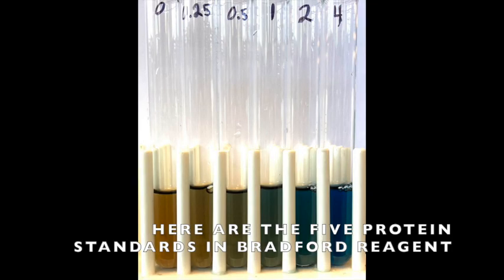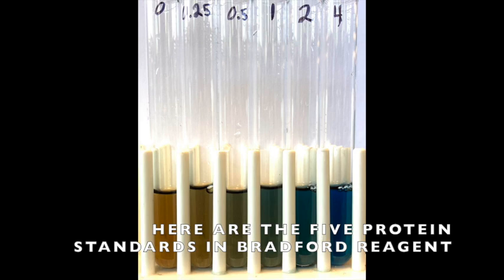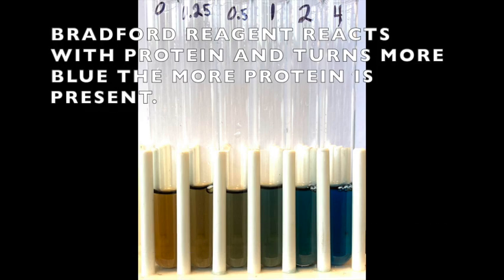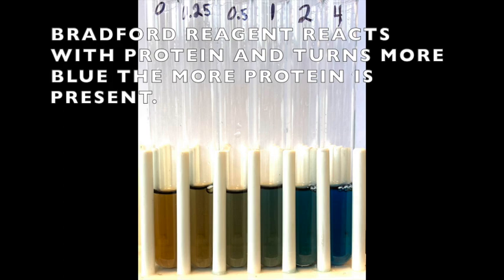Here are the five protein standards in Bradford reagent. As the protein concentration increases from left to right, the Bradford reagent reacts with protein and turns more blue the more protein is present. So the bluer the sample, the more protein is in it.